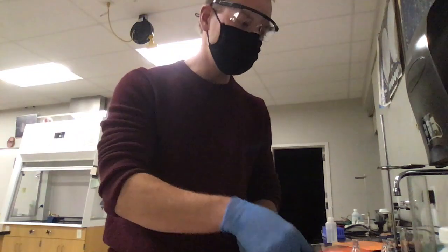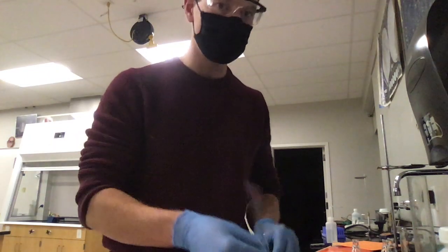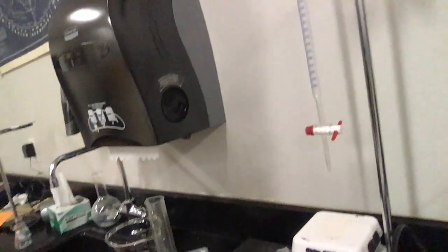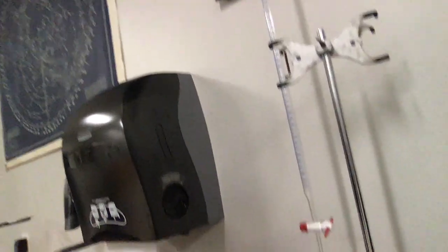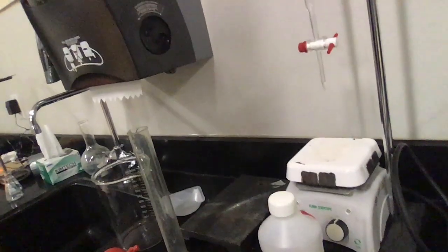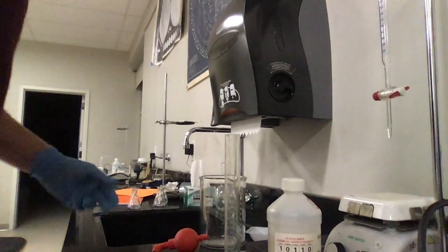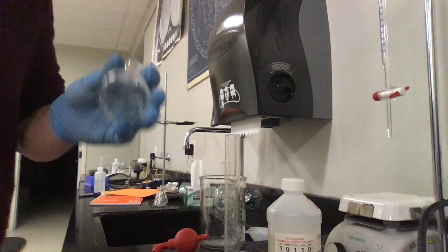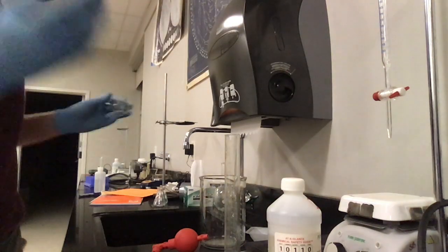I have a volumetric pipette, which I'm going to show you guys about in just a second. And over here, I've got my burette set up on this magnetic stir. I have my Erlenmeyer flask, and I have to grab a magnetic stir bar at some point before I start this lab.